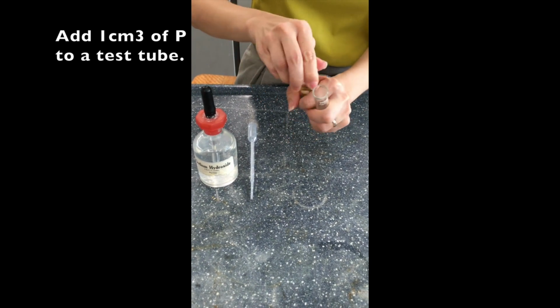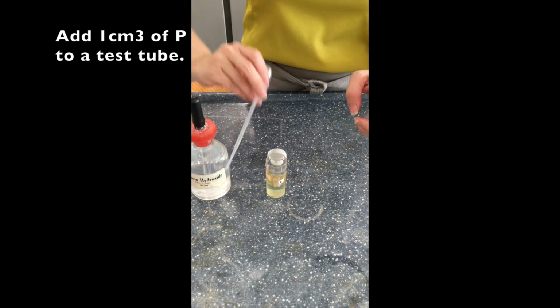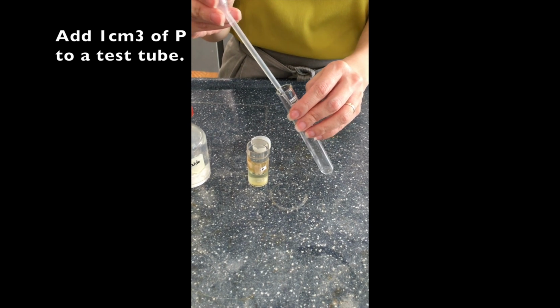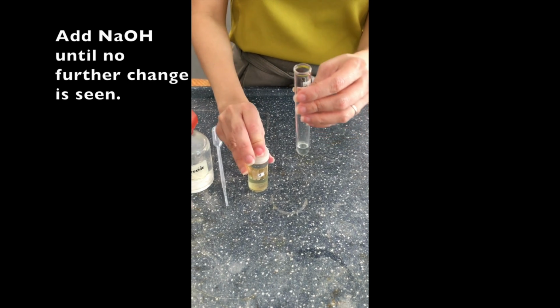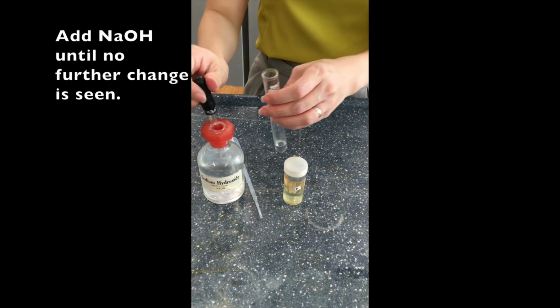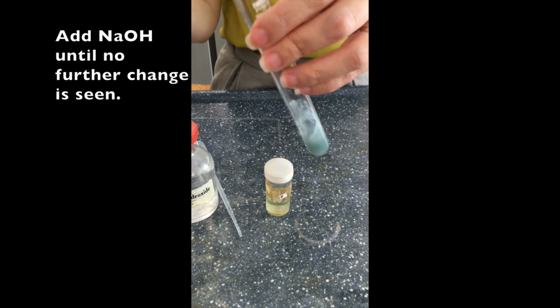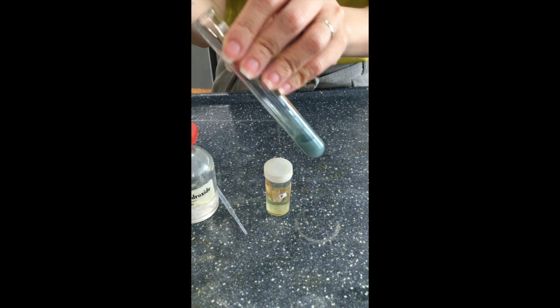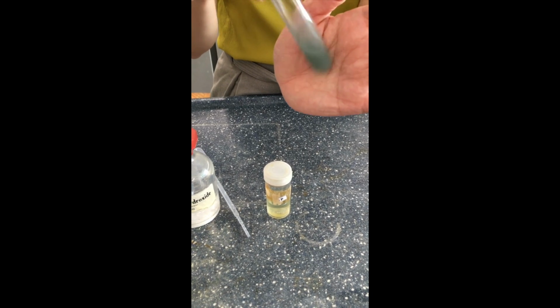So once everything is prepared, we will now add 1 cubic centimeter of P into a test tube. This means about 1 pump. Next, we will add sodium hydroxide until no further change is seen. So we are looking for a PPT. So this PPT is green. So when we see a green PPT, we can look at the chart and we would think that an iron 2 ion could be present.